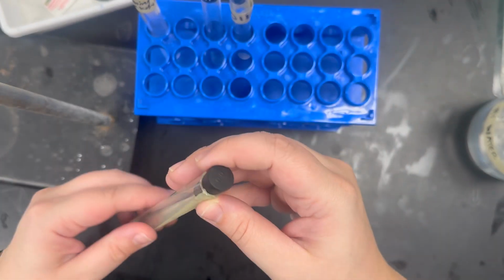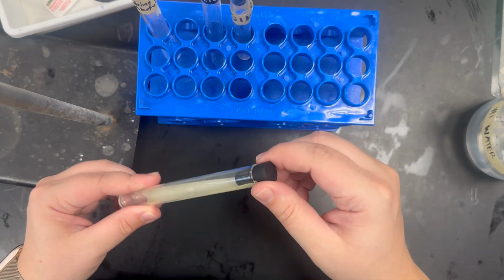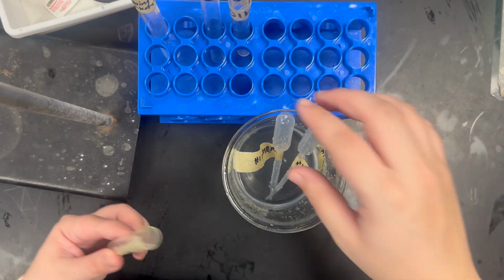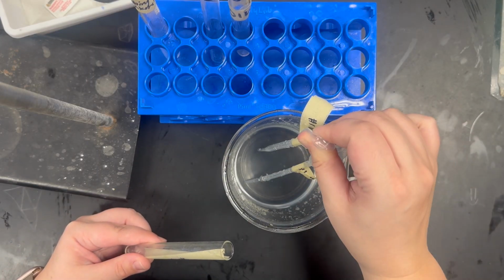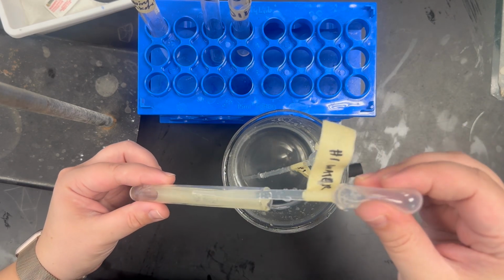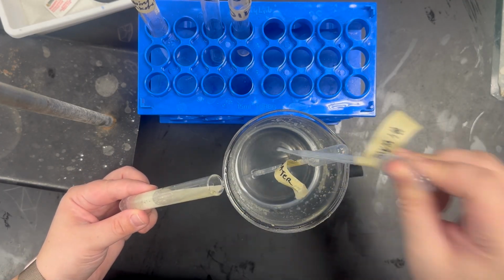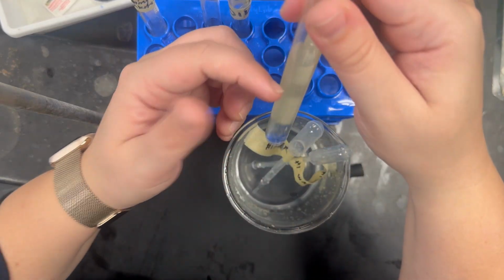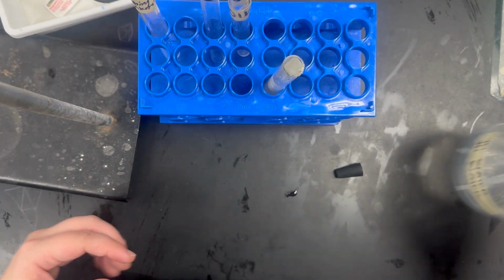So the first thing you're going to want to do is go up to the teacher's desk with your test tube and get 2 or 3 pipettefuls of the liquid. So I brought it here just for ease. The way these work, if you squeeze it, put it inside the water, slowly let go, it sucks up the water. So we add 1 pipette full, add 2, anywhere between 2 or 3 is fine. Kind of want it halfway to 3/4 of the way full. And then go back to your seat.